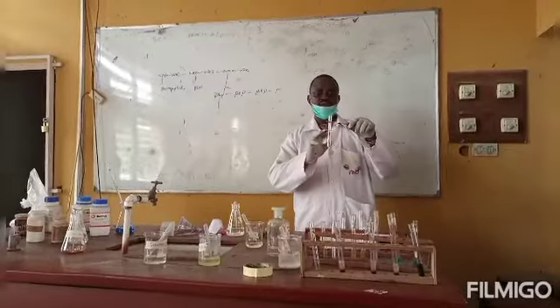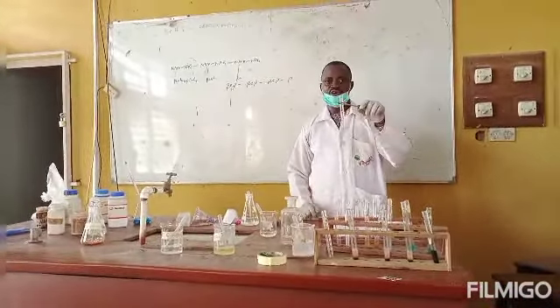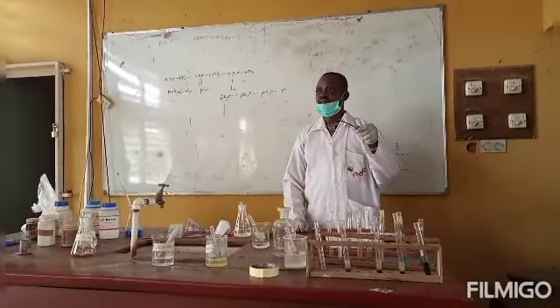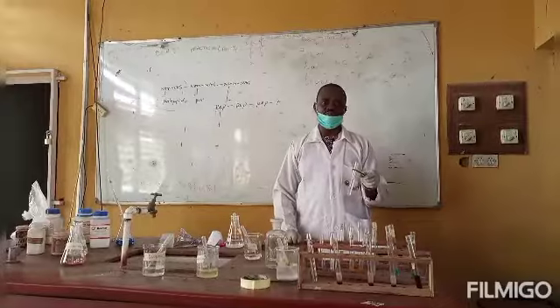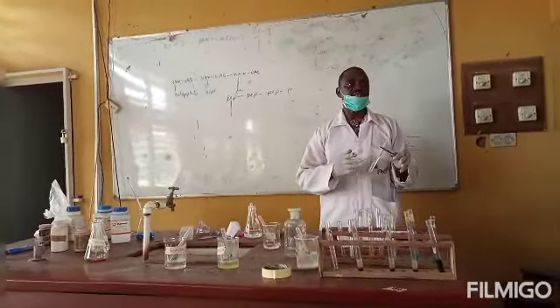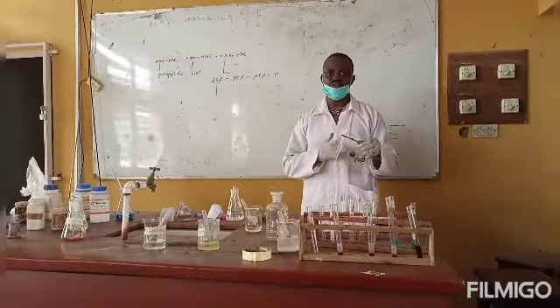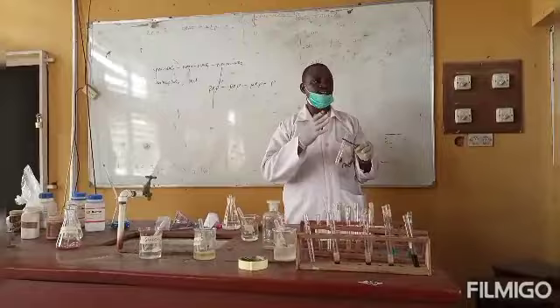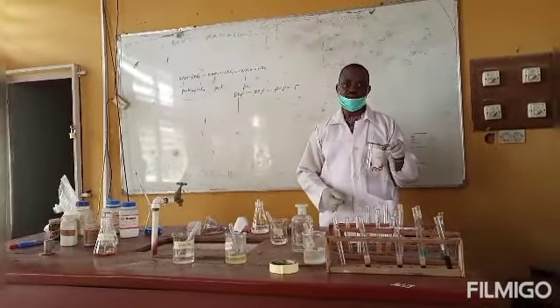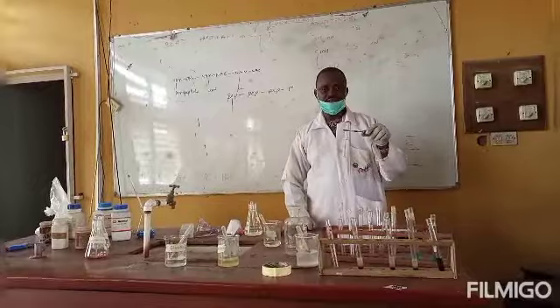Sucrose has been added to this test tube. That's our test solution. With 5 drops of concentrated hydrochloric acid added to it, it was boiled, or heated, for 5 minutes. The purpose of these two procedures is that the concentrated HCl will carry out acid hydrolysis of the glycosidic bond between the glucose and the fructose, while the heat, in case the concentrated HCl is not able to do that, will carry out thermal hydrolysis on it, so that the bond is expected to have been broken.